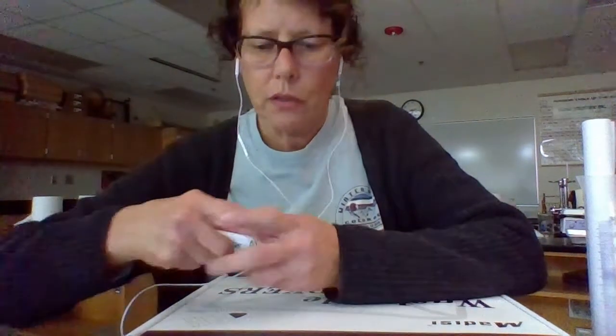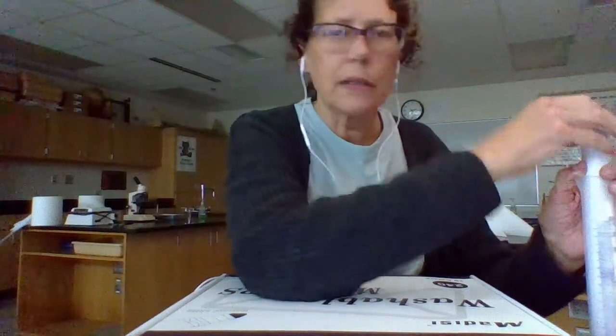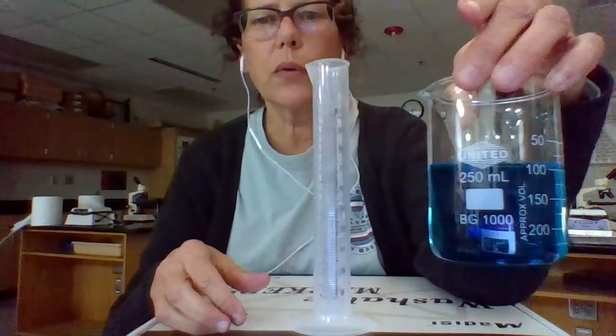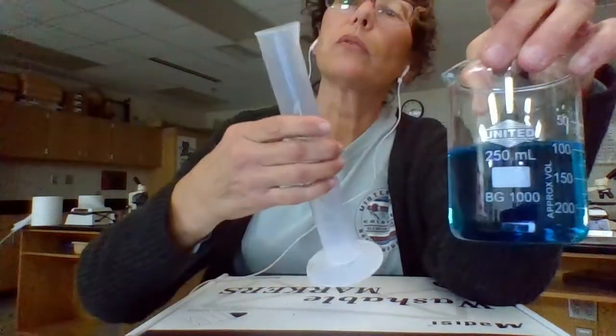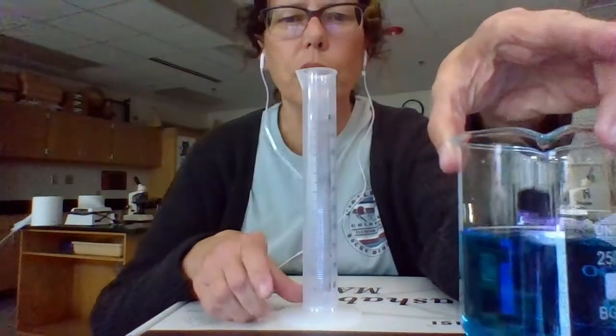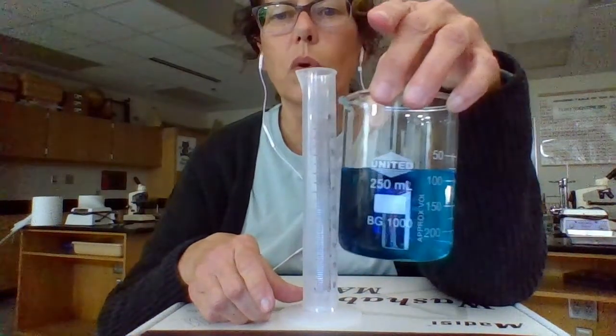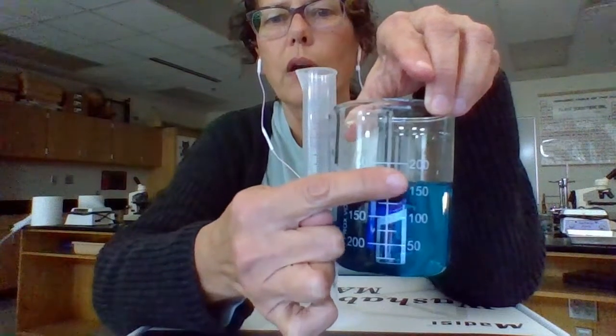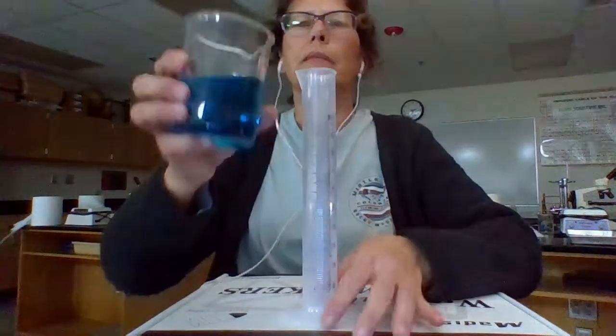Okay. And by the way, when you measure with a graduated cylinder, when you measure anything where you have to actually eyeball where the end of the thing you're measuring is, you need to get your eye right on level with it. So let me show you what I mean. So I have my graduated cylinder here, and let's say I want to see how much liquid is in it. Let's see, this goes up to 100 milliliters. So I can't pour this whole thing in because I have more than 100 milliliters in it, if you see. More than 150, actually. More than 150 milliliters. So I'm just going to pour some in.